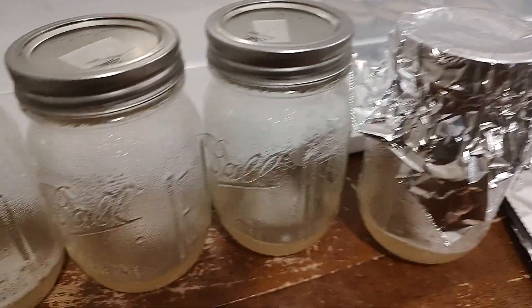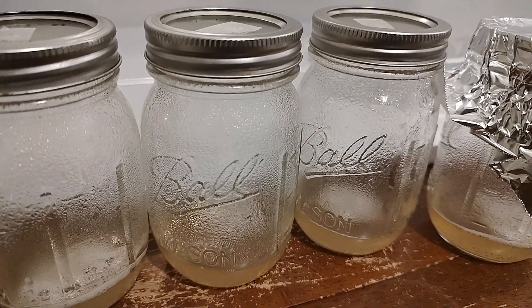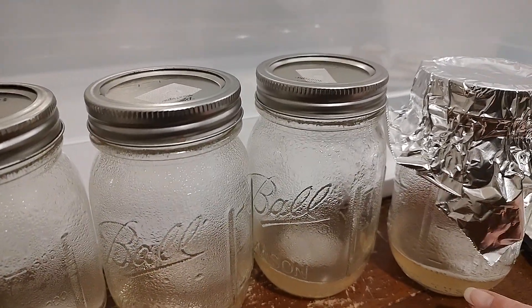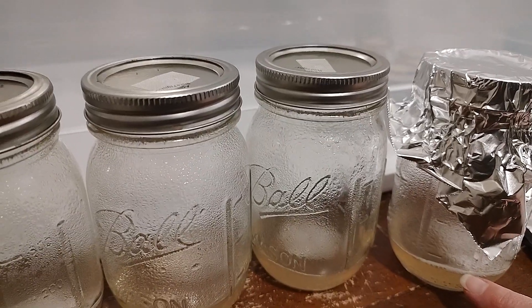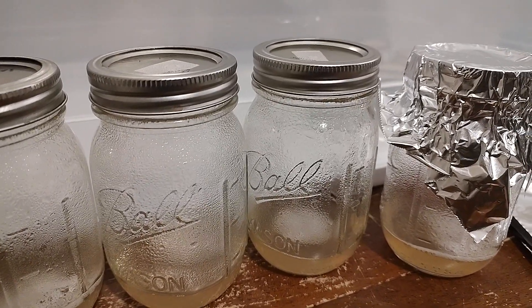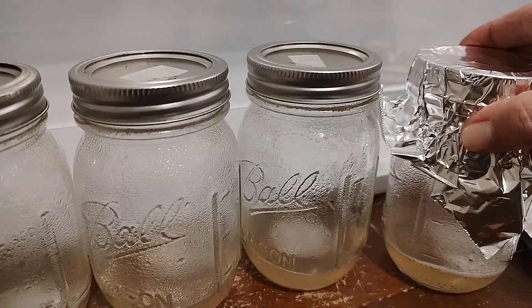The recommendation on this recipe in these jars is 45 minutes at 15 psi. But you don't want them to sit in the pressure cooker after — anytime you're working with anything with sugars or dextrose, you don't want to burn or overcook. So allow the pressure to leave your pressure cooker and carefully remove them without burning yourself, keeping them level.